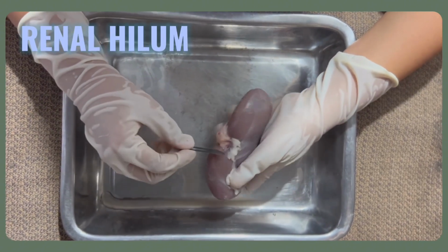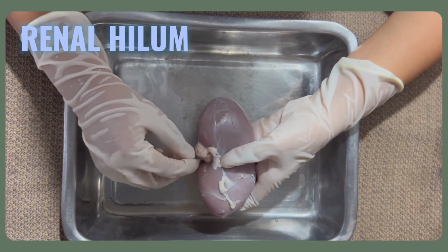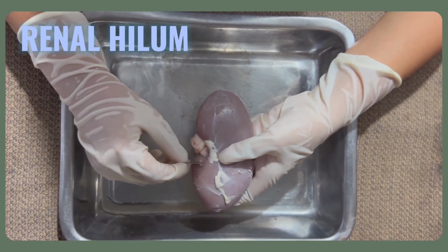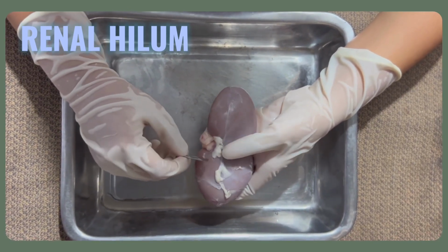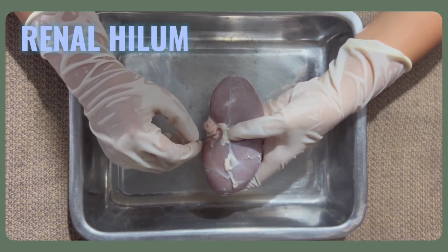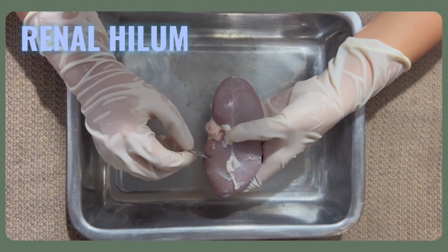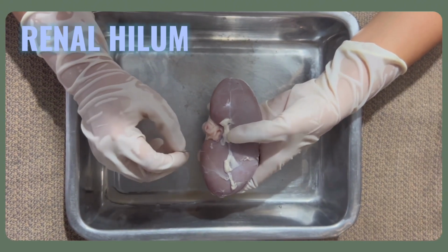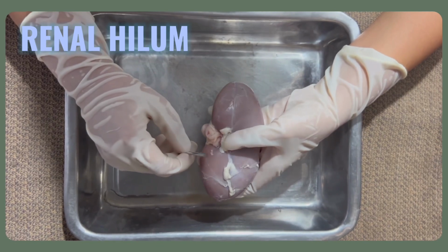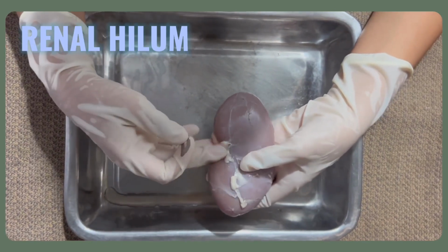Next is the renal hilum. It is a concave indentation located in the middle of the kidney. It is the point at which the renal artery, renal vein, and the ureter enter and leave the kidney. The renal hilum acts as a gateway for blood and urine to enter and exit the kidney, and it is essential for the kidney to perform its primary function of filtering the blood and producing urine.